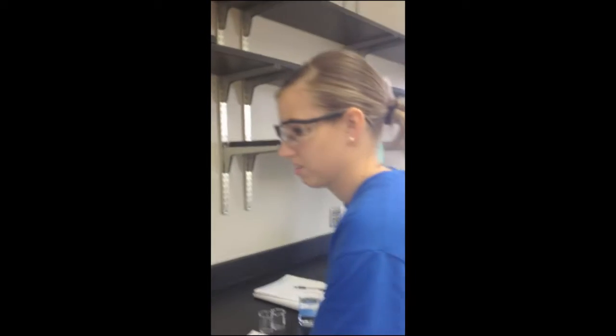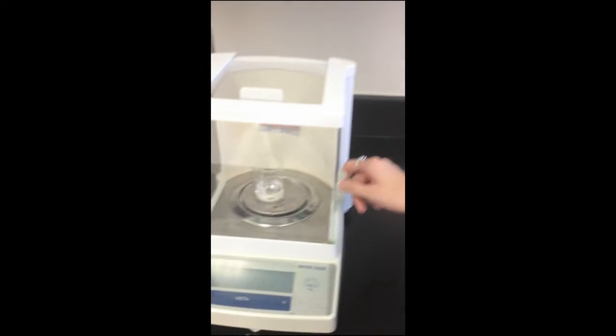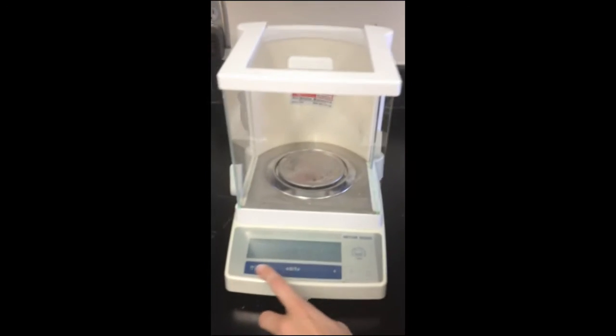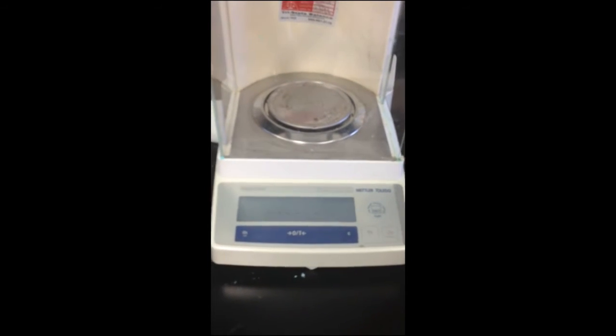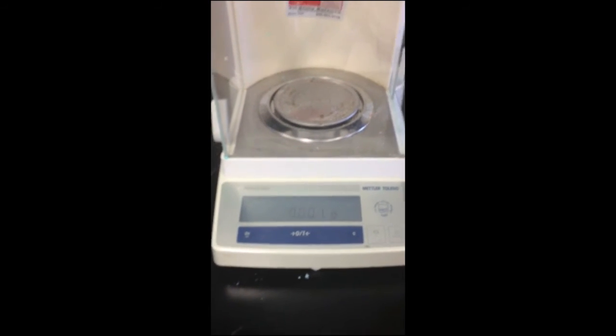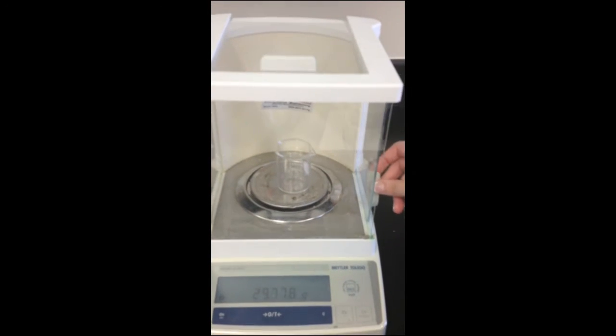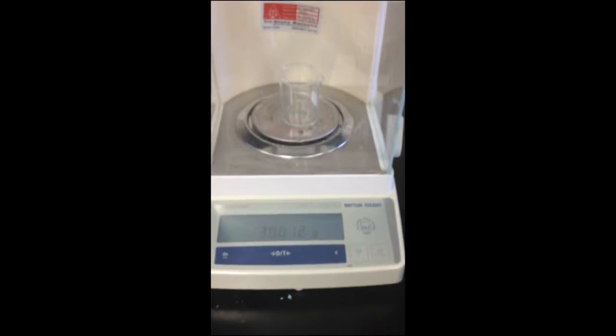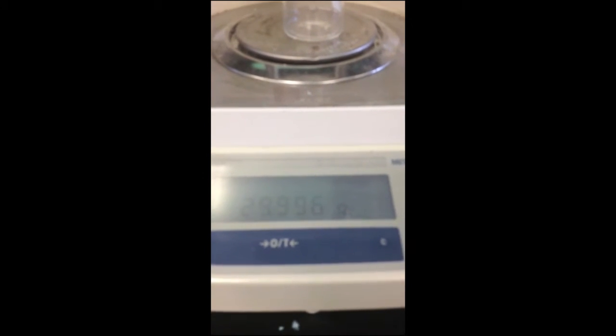My name is Susan, and I'll be doing the same thing. Start the new beaker. Place the beaker in. The initial mass is 29.99.